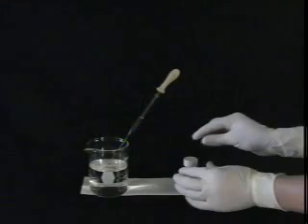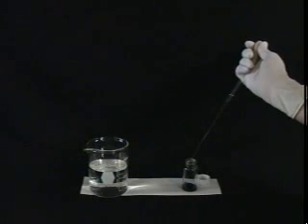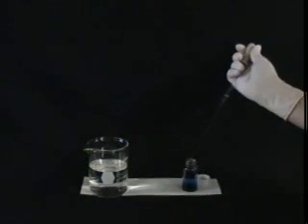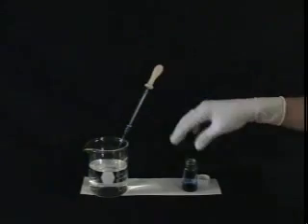Now you're ready to load your sample onto the column. There are a couple of ways to do this. If your sample is soluble in the chosen solvent system, then it is easiest to load your sample as a solution. Dissolve your sample in the smallest possible volume of the chosen solvent mixture. If you have trouble getting it to dissolve, try adding a few drops of methylene chloride. It is vital that your sample is completely dissolved before you add it to the column.